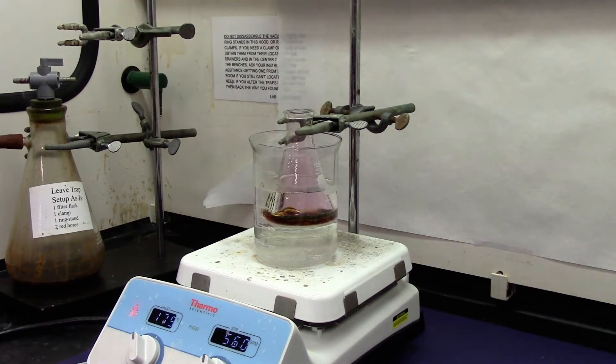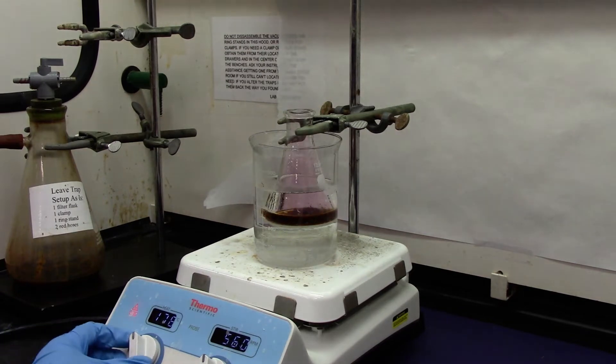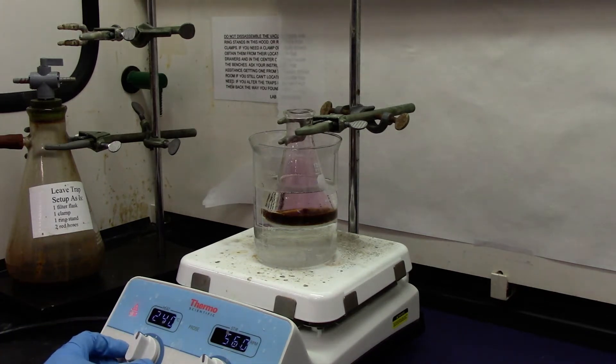It's been about 10 minutes. We will increase the heat for the water bath to get to about 90 degrees Celsius and heat the solution for another 10 minutes.